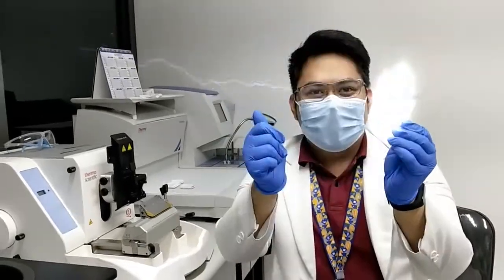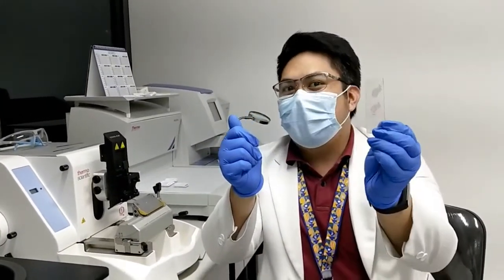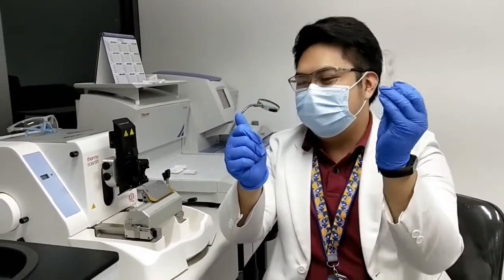Our ultimate goal in microtomy is to transform these tissue blocks into tissue slides. Let's start.